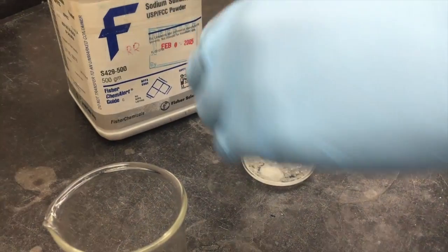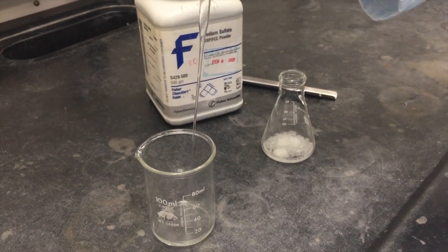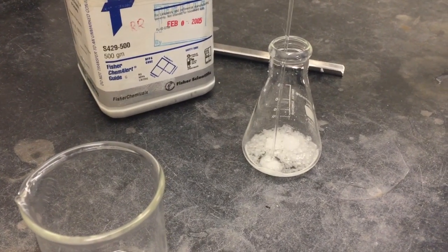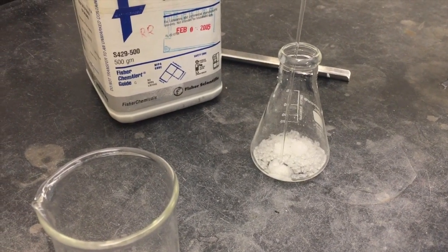Filter out the organic solvent by transferring it to another flask or beaker. Repeat this until all organic solvent has been filtered out.